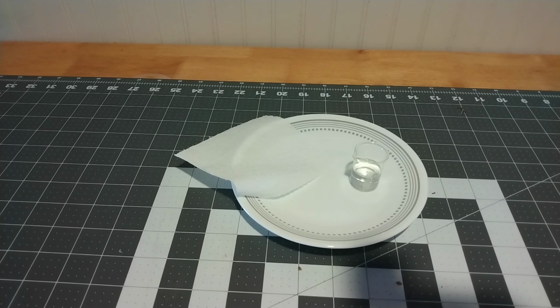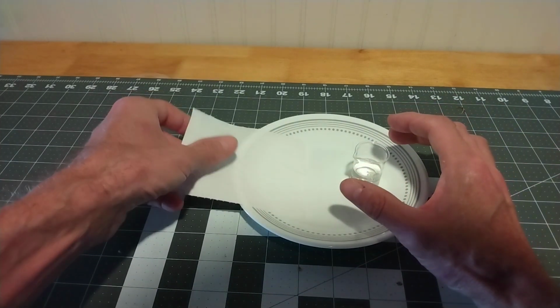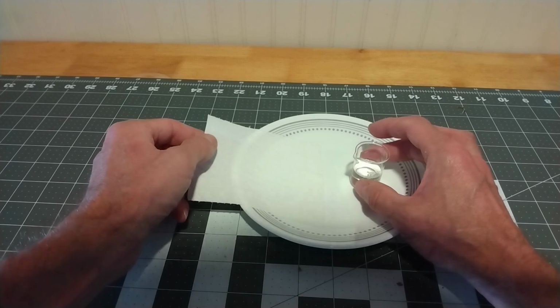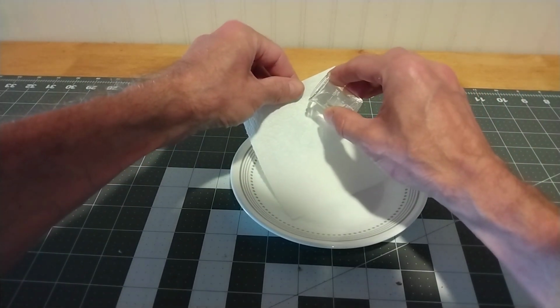So I challenge them to dip their finger into their safe boiling water, and I am gonna dip mine in 98% sulfuric acid. Let me prove that what I have here is 98% sulfuric acid. It is well known what it does to a paper towel.